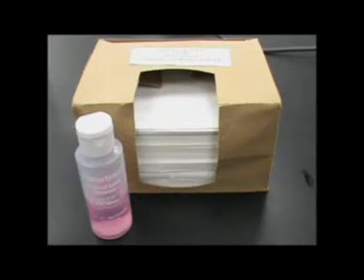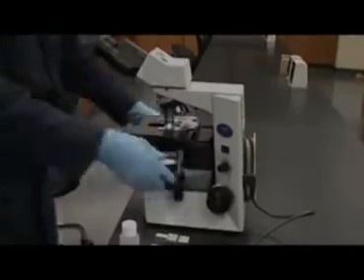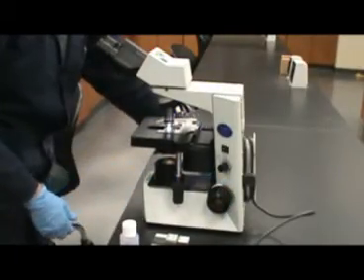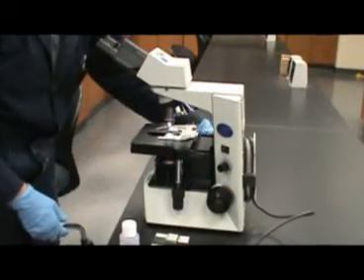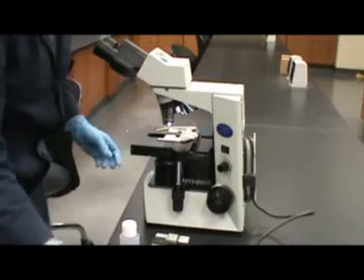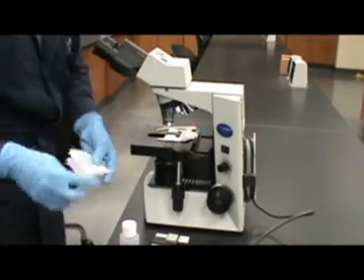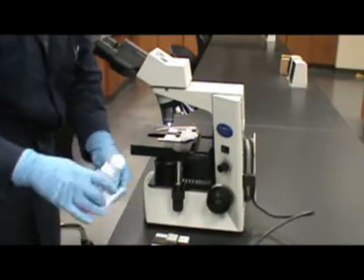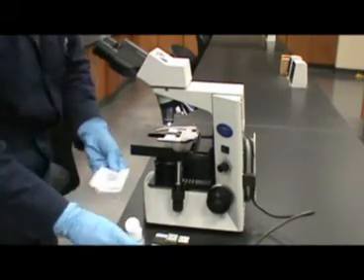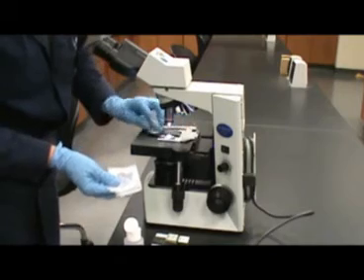Ocular lens paper and ocular lens cleaner should be used when cleaning up the microscope. To begin cleaning the microscope, lower the stage to the bottom and remove the slide that you were observing. Using tissue paper and ocular cleanser, you should first clean the slide of any oil residue that may be present on it.